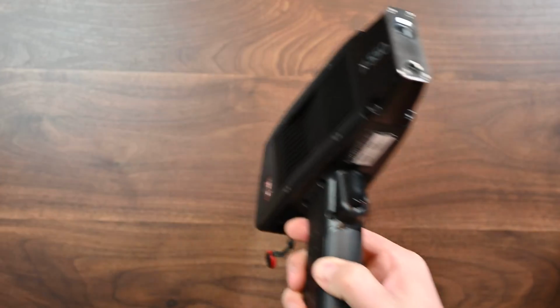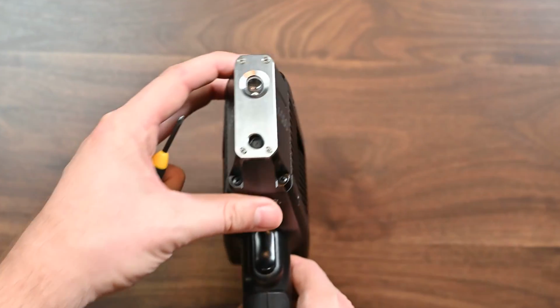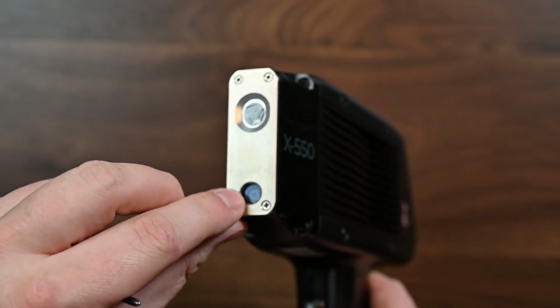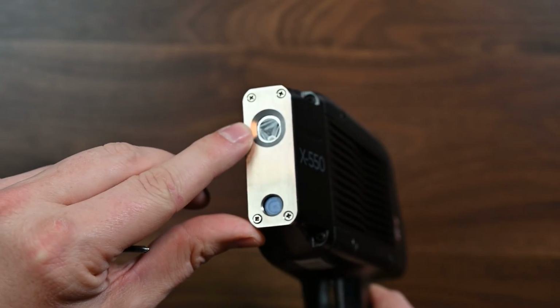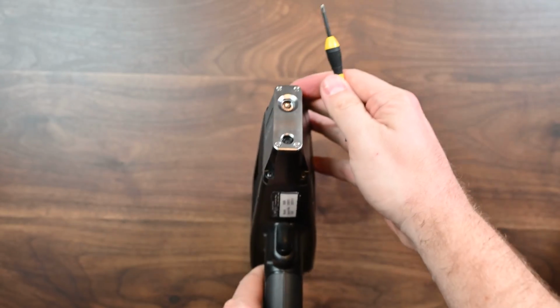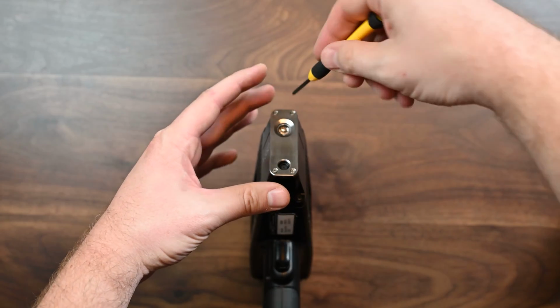So the first thing you're going to do, if you have a nice clean surface, you're just going to turn the analyzer up like this. I'll show you guys here a nice close-up what this looks like. Essentially that little film there, that plastic film, is what we're going to be changing. Down here is actually the camera, so we're not going to touch that, but right here, in the light, you can see that film, that's what we're going to be changing. So I'm going to set it on the back, which will be a little bit at an angle. It's actually better that way because what you don't want to do is drop anything inside of that, and you'll see that here in a second.